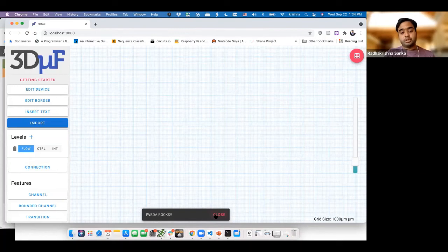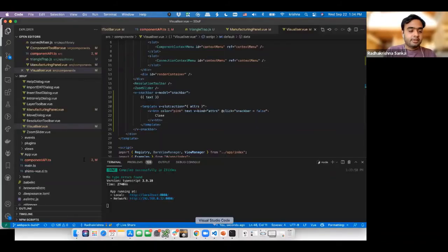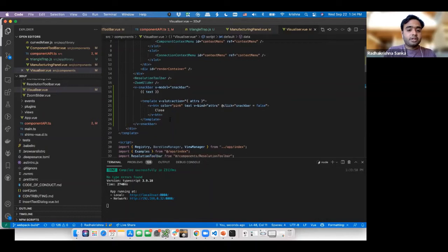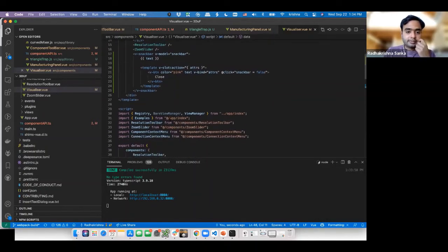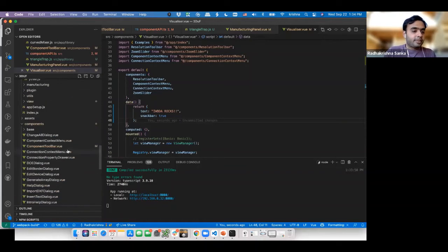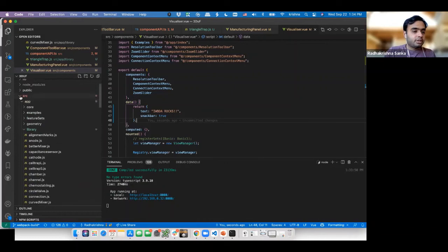So it was that simple to actually add it. Now, if we actually want to bind it to the button click, what we'd do is go in and wire up that button click to actually fire this event. And the way we do this is by using what we call the event API. And so I'm going to go up. Where's the event API?